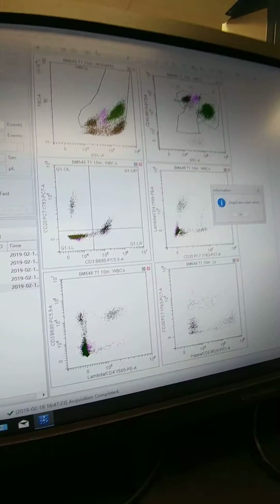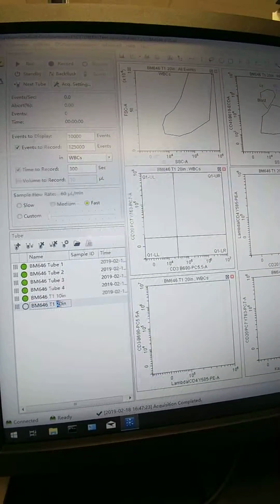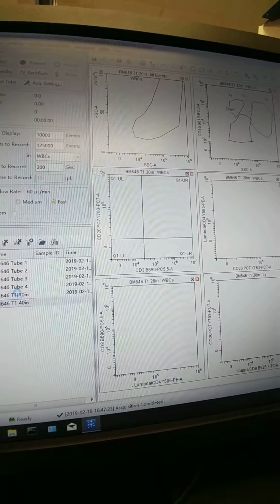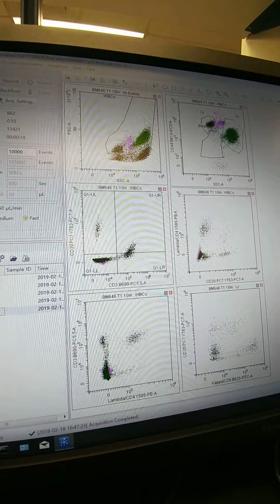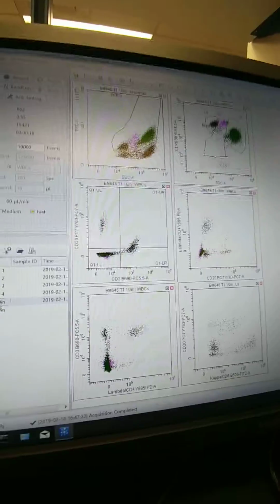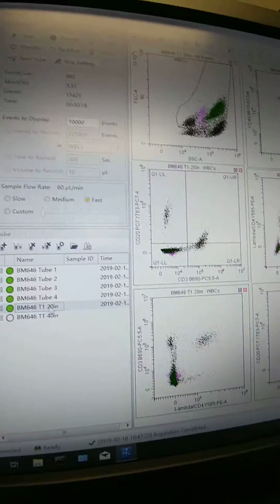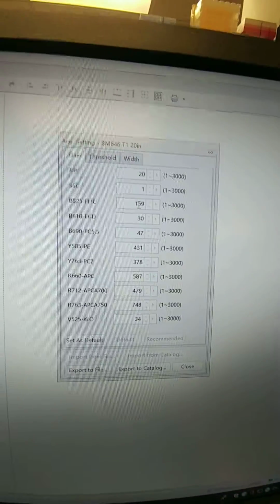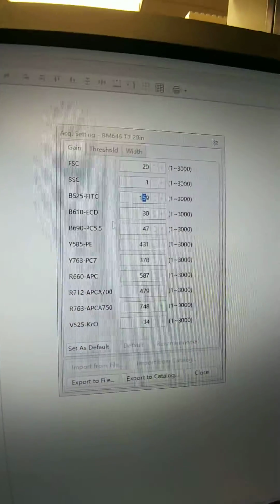Now I'll change this, oops, it doesn't like the duplicate name. Change this one first. I'll change that to 40, because now it'll be 40 higher than it was originally run, and that was 20. So when I go to analyze, I'll have to change that list mode file. Now we're going to add another 20, so from 159 to 179.